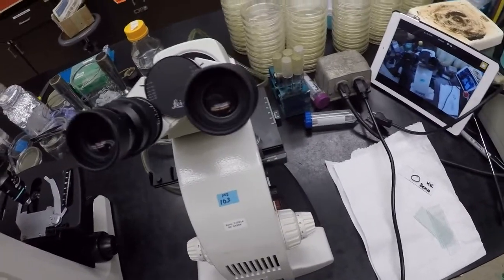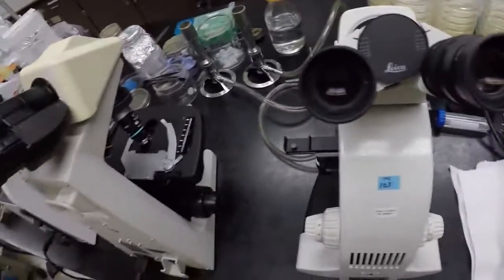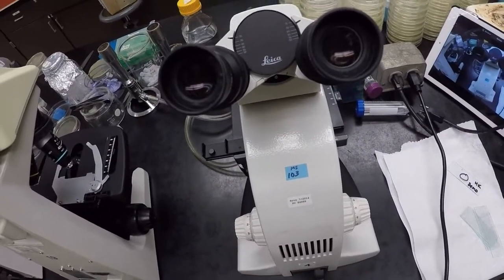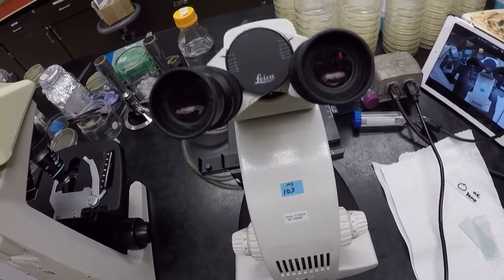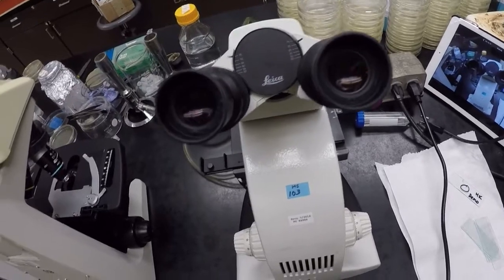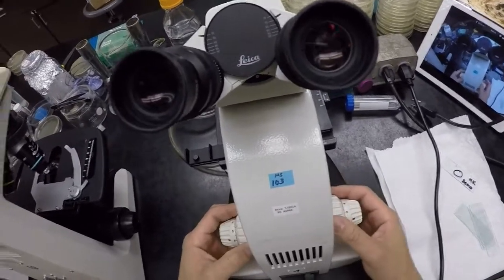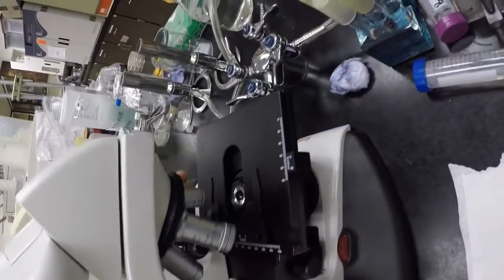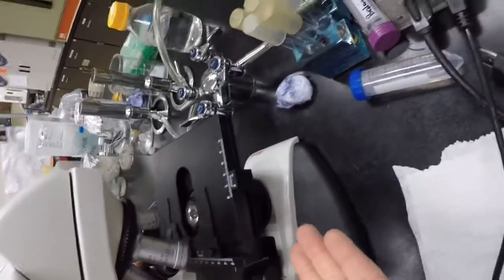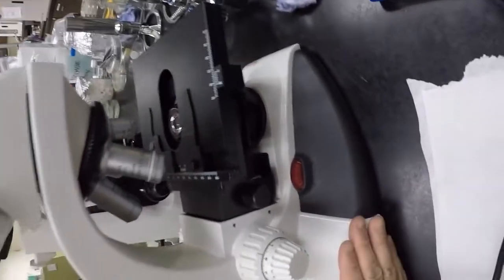Couple of things I want to say, right? The lenses are very expensive. They're about $1,000 each. So we want to make sure that we protect our lenses, especially our high-powered lenses, right? What I want you guys to get into the practice and habit of is, as soon as you grab the microscope, turn the stage all the way down, right? And we know roll forward is down, and then also 4 times lens in place. This is the shortest lens, so this is what I call safe position. It gives us the most space between lens and stage. This is the one that protects our microscope.